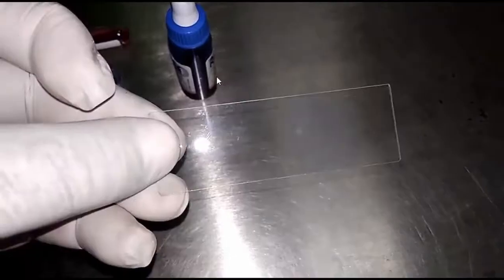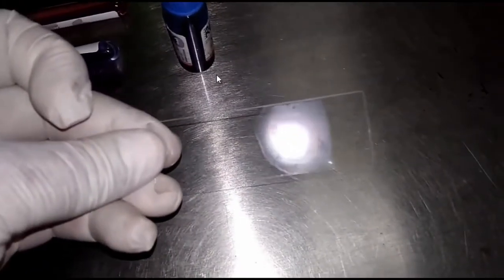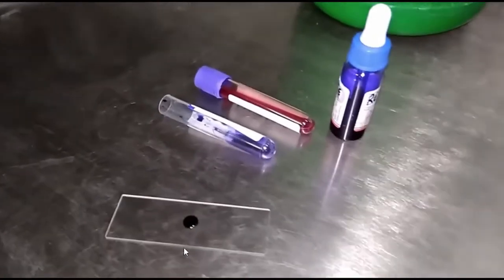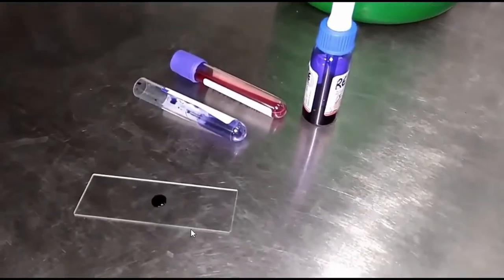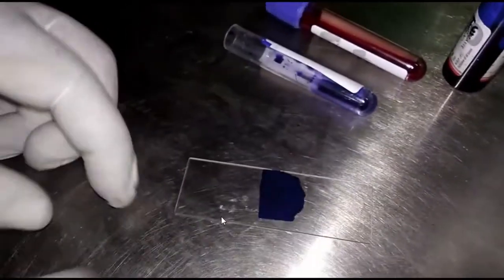Make a smear in this way. So this slide is for observation under microscope at 100x objective, and this one for 40x objective.